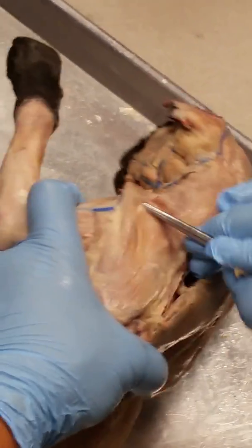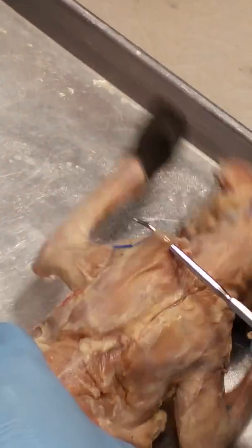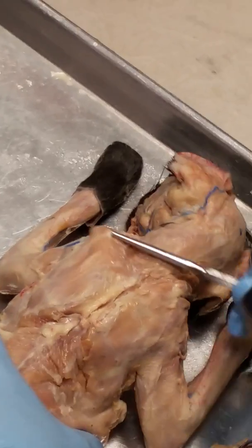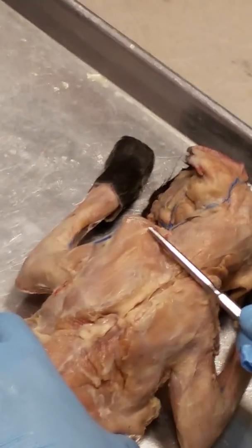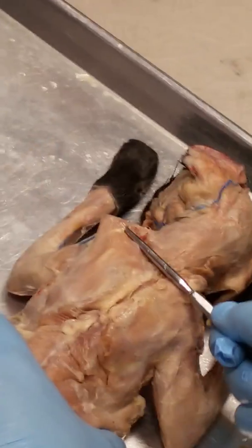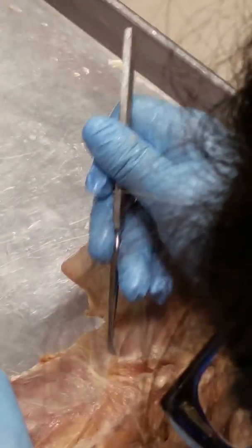Now we didn't go over this muscle right here. This is a long muscle name. If I pull on it, it shrugs the shoulder of the cat. This is the levator scapulae ventralis. Okay? All right. So we have our spinotrapezius here. I'm going to go over these.